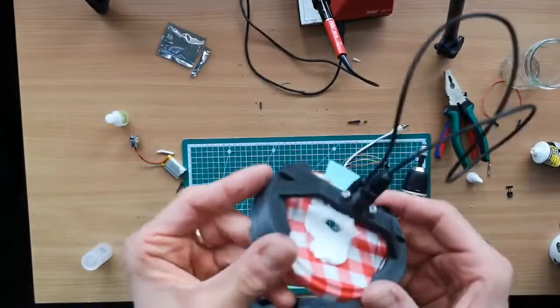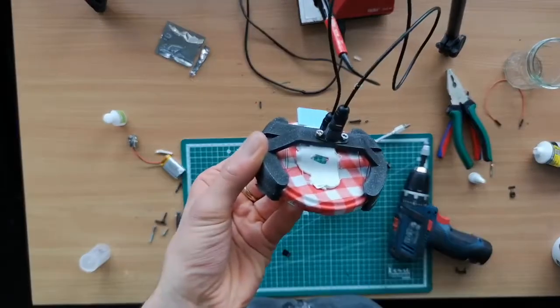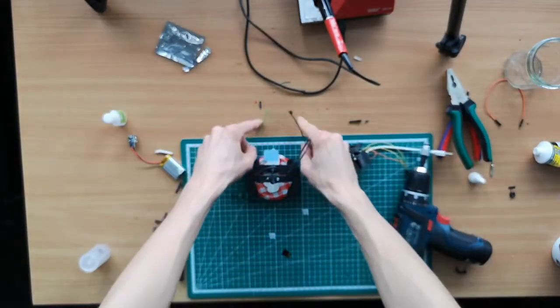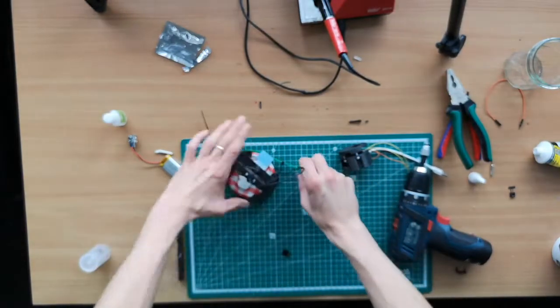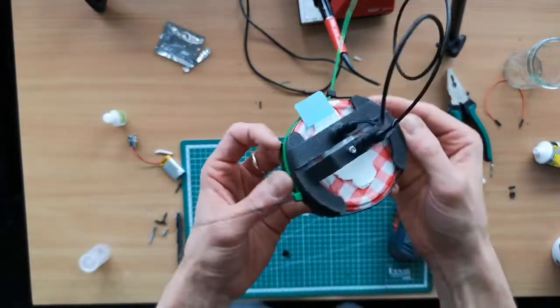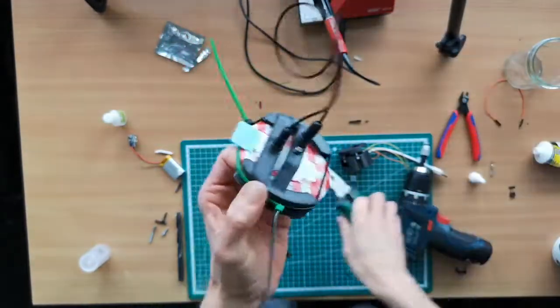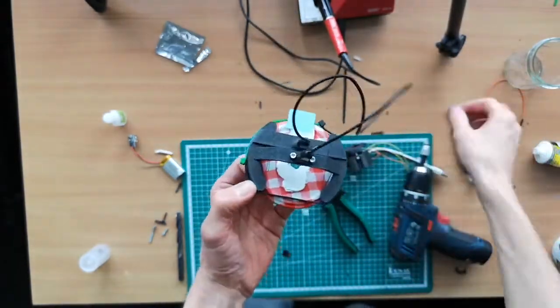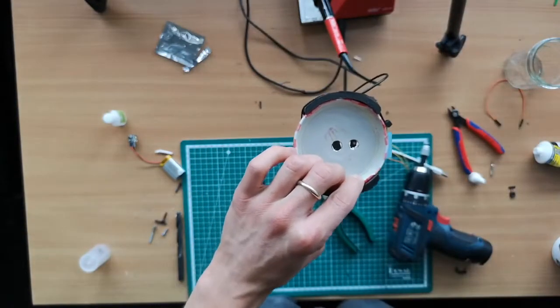You will already see that it's not fully tightly packed, so for this we can use the cable ties. I have two, and then we just need to wrap it around and tightly seal it. And once it's fully through, you cannot really move it anymore. That's it then. Then you can get rid of the auxiliary parts, and you're done. So the illumination gets here, and then you transmit it through the objective lens. That's it.